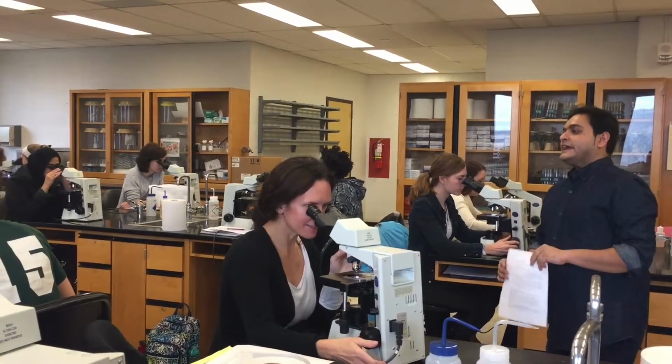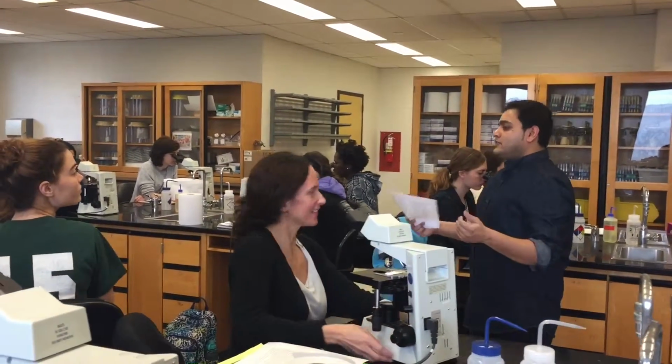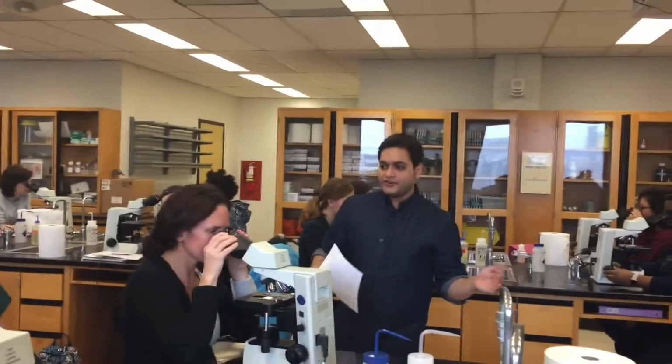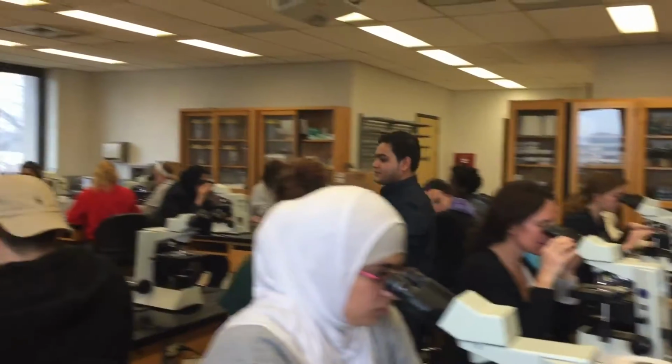Oh, okay. Since you don't know what you're looking for, you may be having trouble finding it. But once you know what you should be looking for, it would make life much easier. Can we have a look real quick?